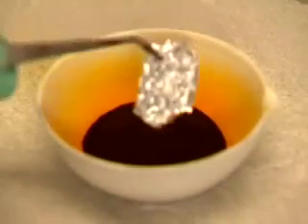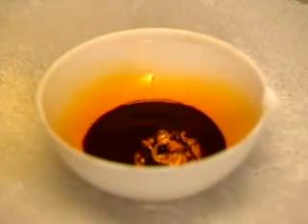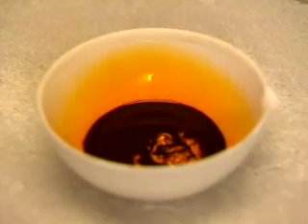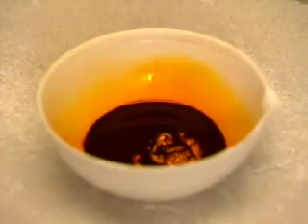With bromine, I just drop aluminium foil into the liquid. There's a short delay, but normal service is soon resumed. Once the reaction gets going, it quickly takes on the appearance of a pit of hell. As with the chlorine reaction, there's white smoke — that's aluminium tribromide.